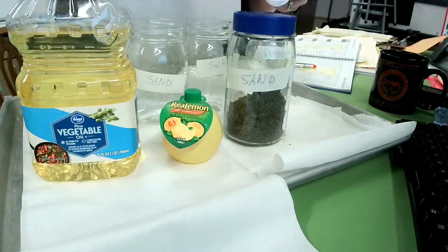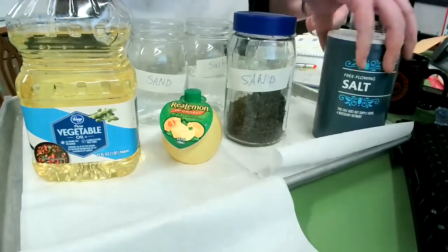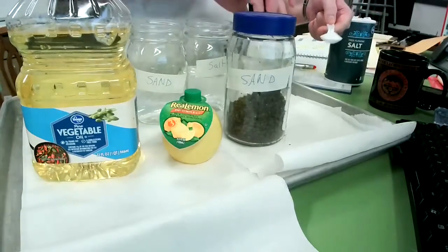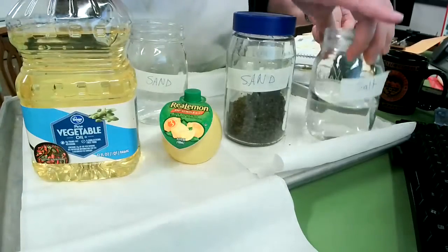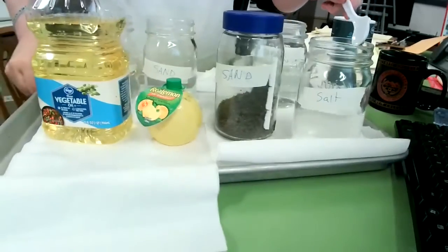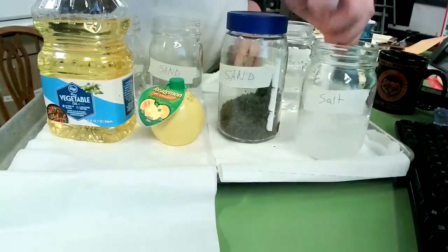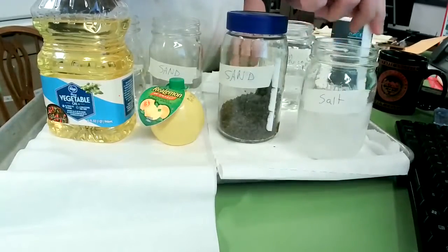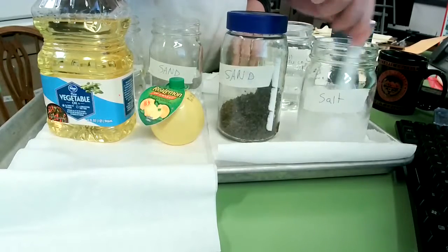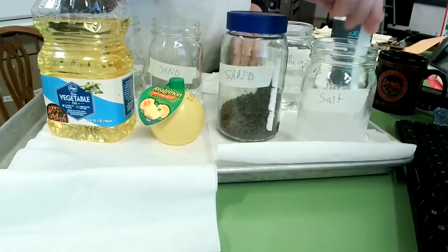Okay, here we go. So I'm going to add one teaspoon of the salt. So let me bring that up here so you guys can, whoops, wrong one, salt. There we go. So I'm going to add it. Just a little bit more so you guys can see that better. And I'm going to stir. So I think the directions say to stir for 1 to 2 minutes. So I'm just going to continue to stir this, okay, and make sure that it's mixed up really good.